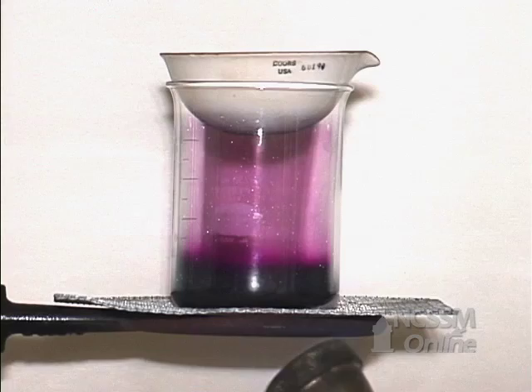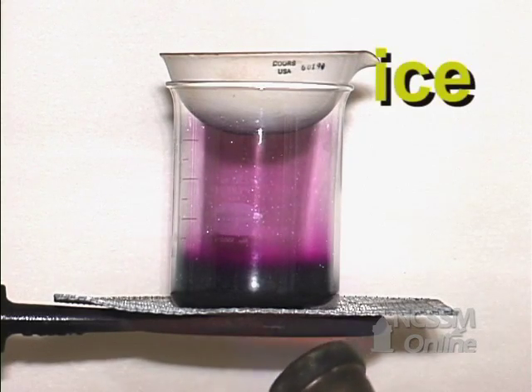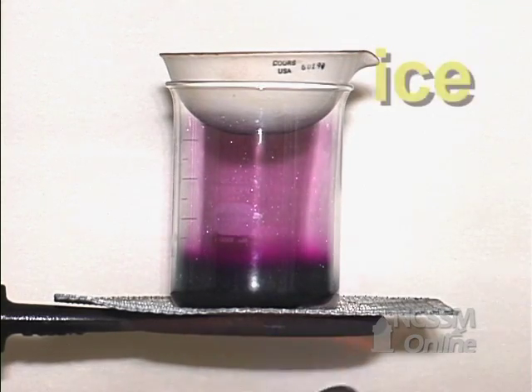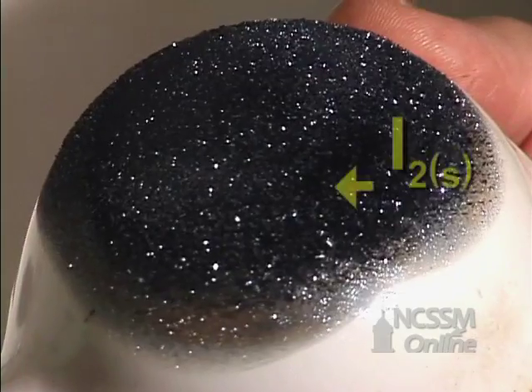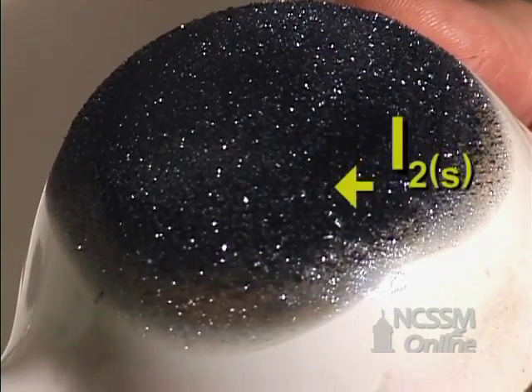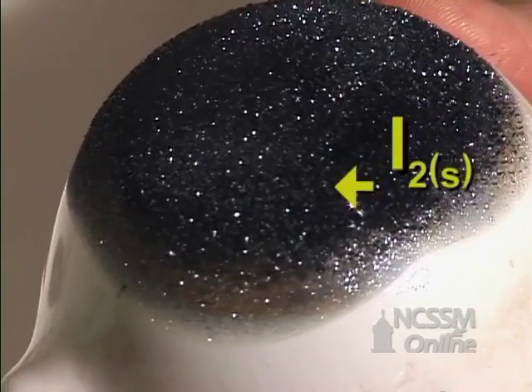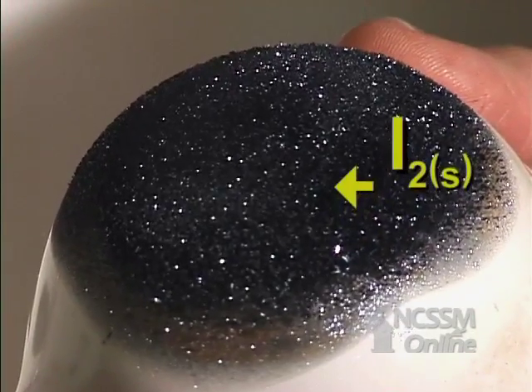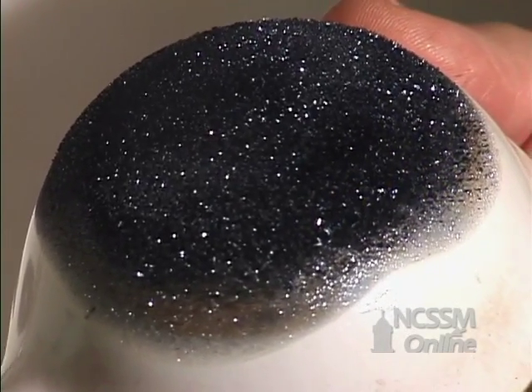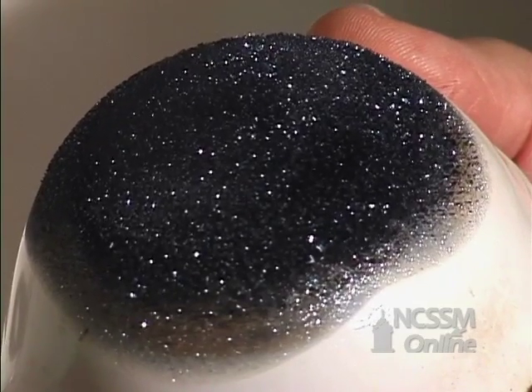The evaporating dish contains some ice to cool the iodine vapor. The iodine will condense directly from the vapor to the solid, forming iodine crystals. The iodine crystals have a very characteristic metallic gray appearance.